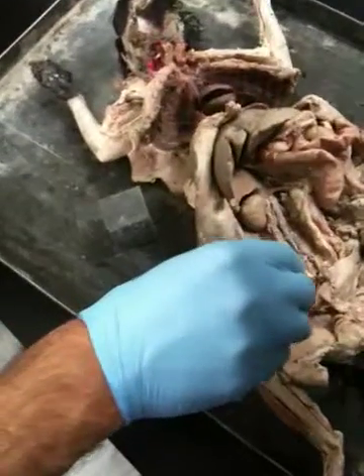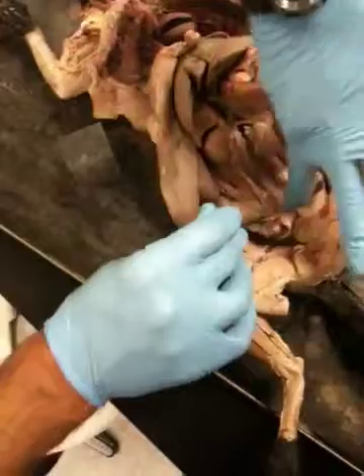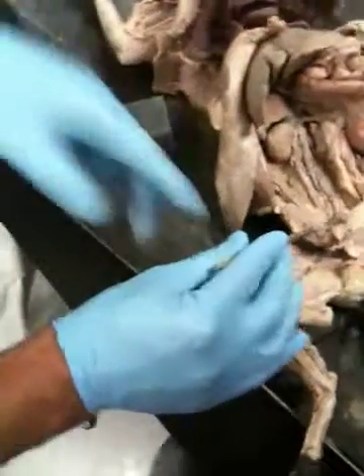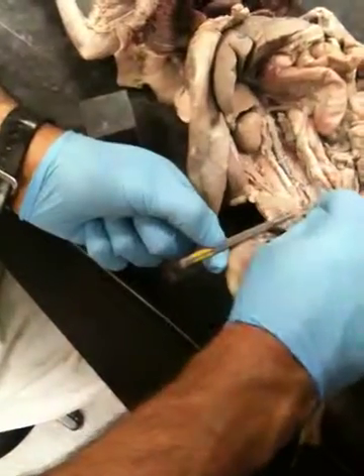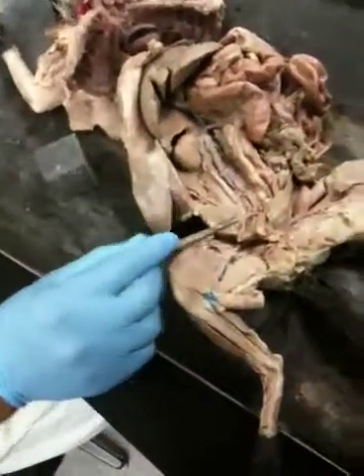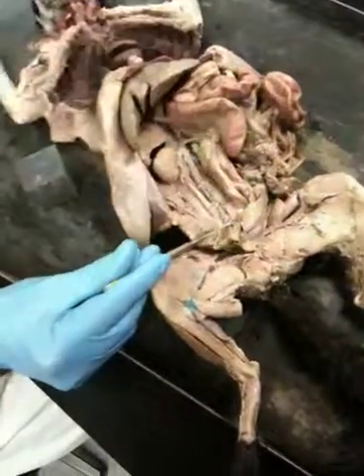There, a medial sacral would be deep. You have to push this through and bring it up, and it would be this one. I have it right there, but then you have to, you see? Okay, because that one goes in the middle, too deep. It's hard to see if you're distant away, but that's where it is right there.